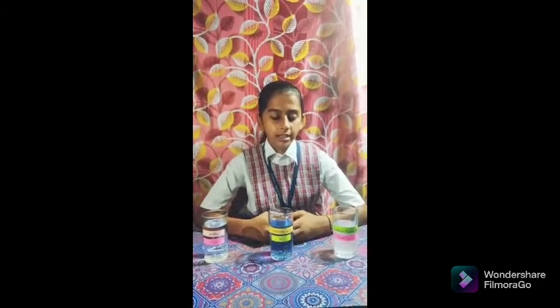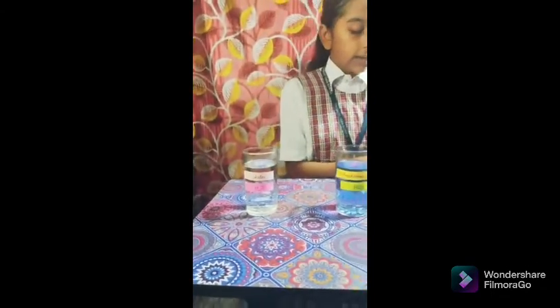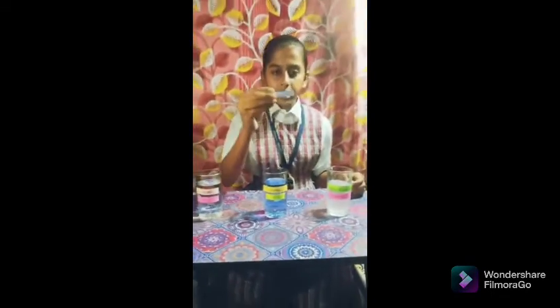This is Sangam Pandey from 10C and I am here to show you an experiment on the effects of litmus paper on acid, base and neutral substances. An indicator is a substance which tells us whether the substance we are testing is an acid or base by a change in its color. Materials required for this experiment are sodium bicarbonate solution, toilet cleaner solution, water and litmus paper.